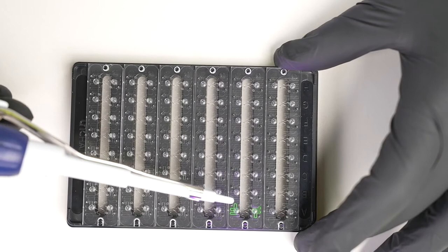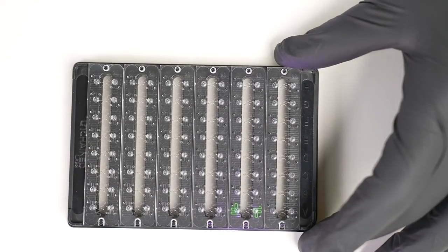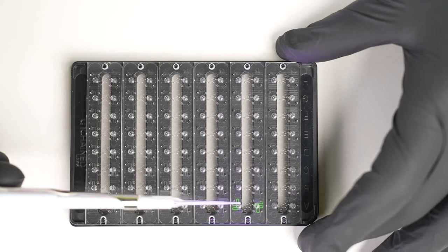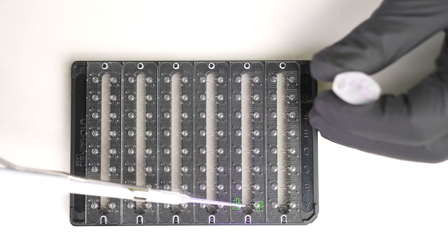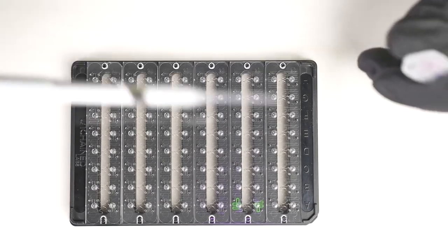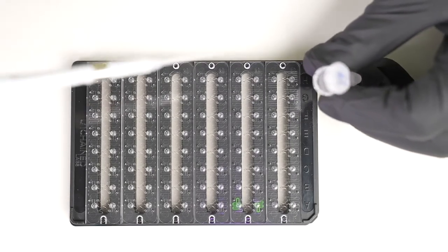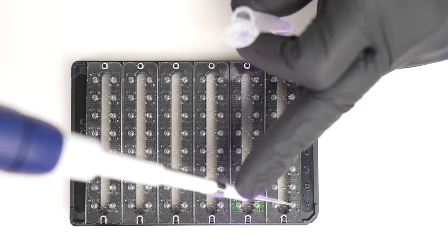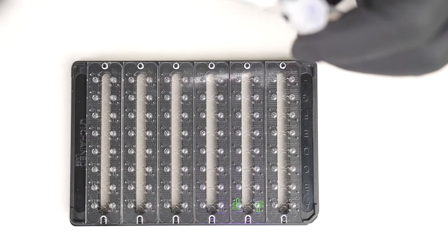You can see in the fluorescence that the serpentine channel leads into more of the microfluidic channel, and in the middle of the Stunner plate where it's transparent, we have all of these little microcuvettes. Inside each microcuvette is where we'll be making the Stunner read. That is a chamber with a known and fixed path length, so there's no moving parts or anything. That makes our UV-Vis reads very accurate and precise, and gives us enough sample volume to do DLS and SLS reads as well. We're not going to run AAV here because of BSL considerations, but I'll just show you a quick example of loading IgG. I'm taking two microliters and dropping it into a well, and that's going to wick in there and be safe from any kind of evaporation concerns.